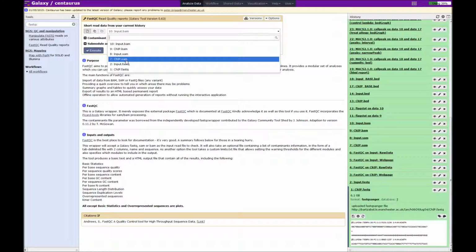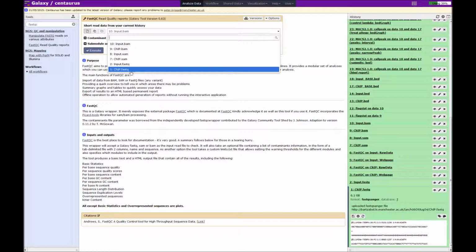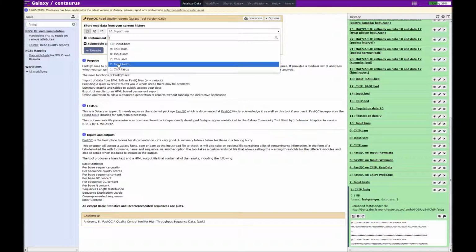you have trimmed the reads, perhaps in the next step, and then want to look back to see what effect that has on the quality of the reads. However, for the moment, we're assuming that we only have the fastq files and haven't performed any further steps.